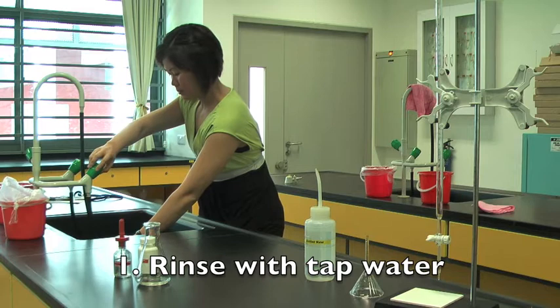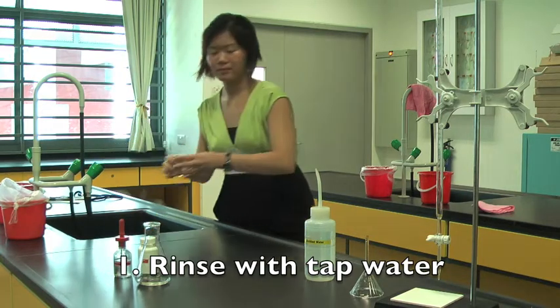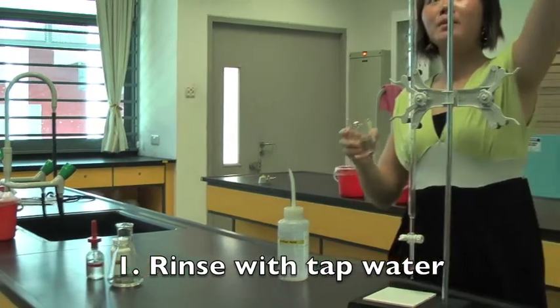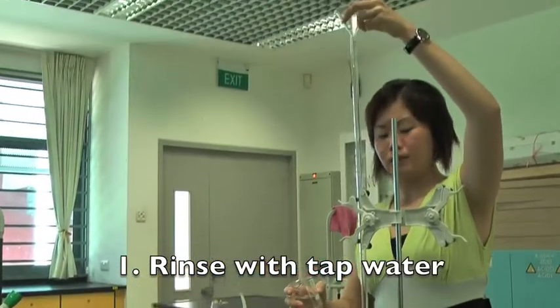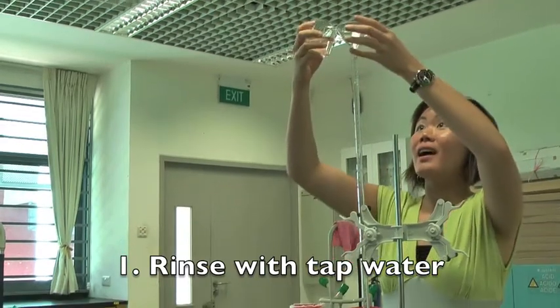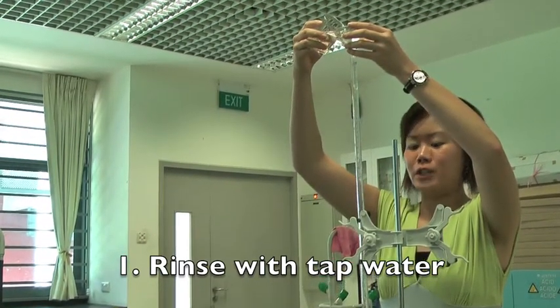Firstly, rinse the burette with tap water. It is a good practice to use the funnel to prevent spillage.